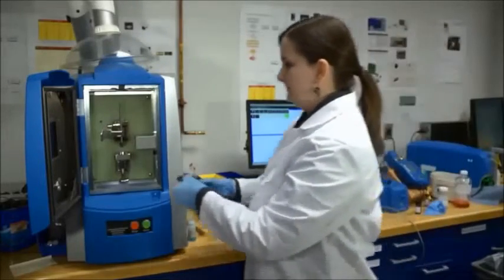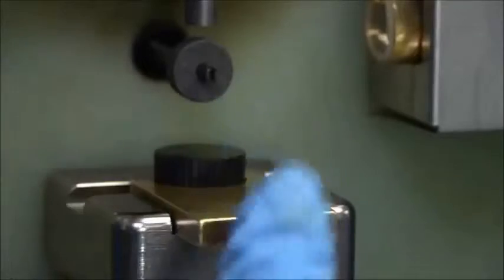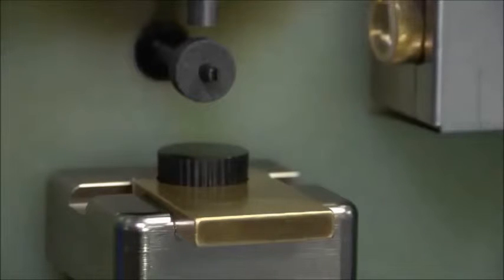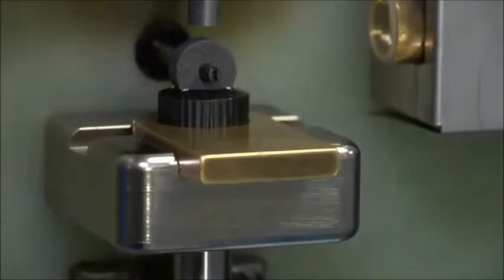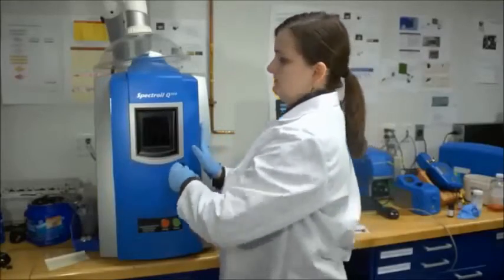As you have your sample, put it in the sample stand, and then lift it onto the disc and shut the door.